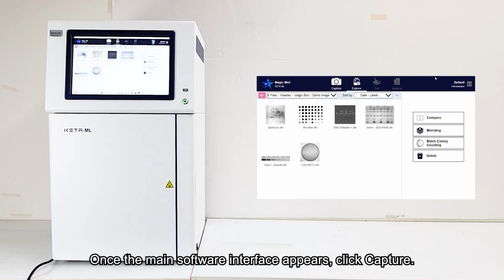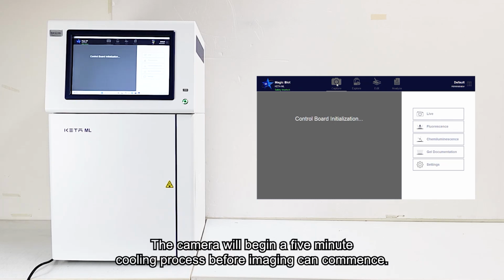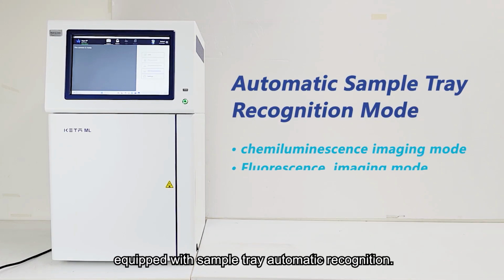Once the main software interface appears, click Capture. The camera will begin a 5-minute cooling process before imaging can commence. The KETA MLX2 is a multifunctional imaging system equipped with sample tray automatic recognition.